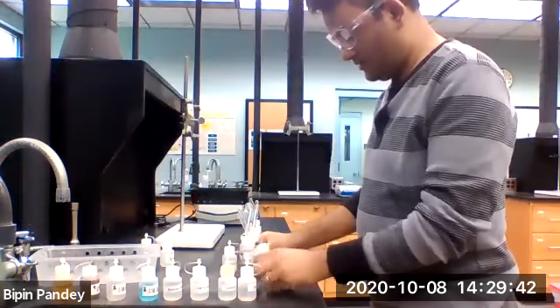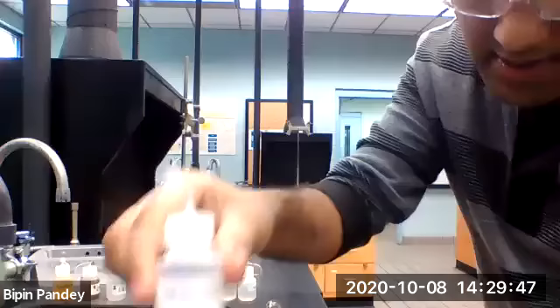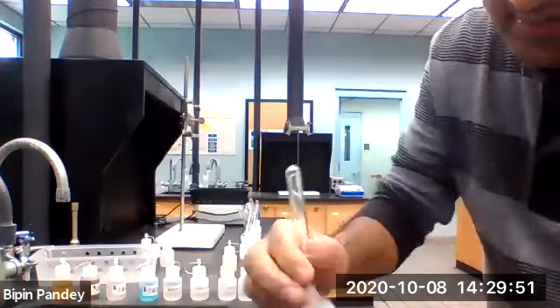Now I'm taking barium chloride and sodium bromide.